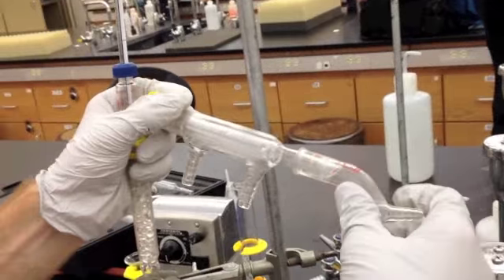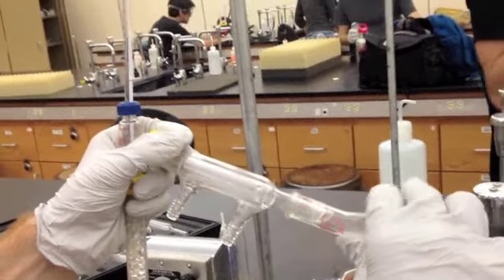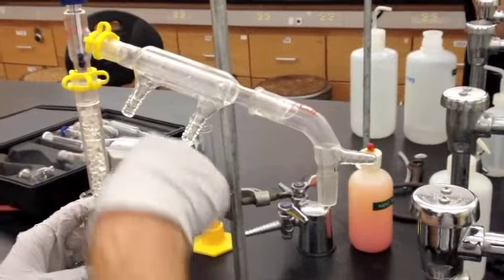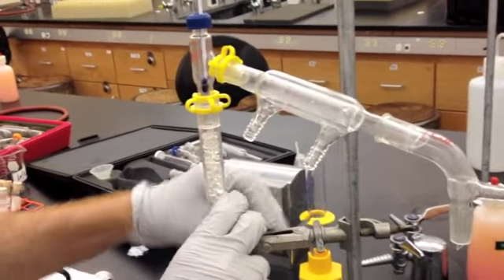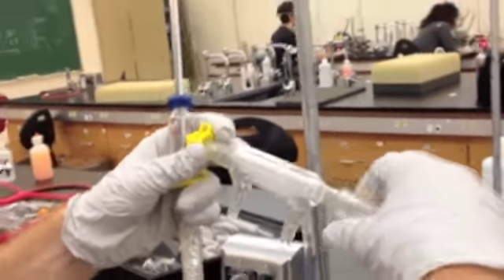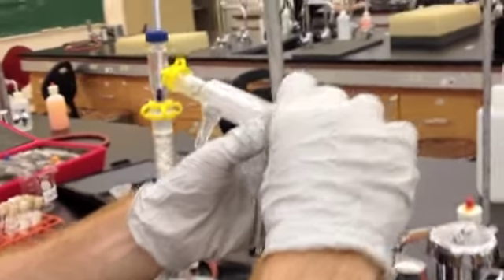Same thing, you can wet the other end which you made and you can insert it into the condenser. Again, you want to make sure your apparatus is always secure. So if you see it loosening up, tighten it a little bit. And again, another keck clamp.